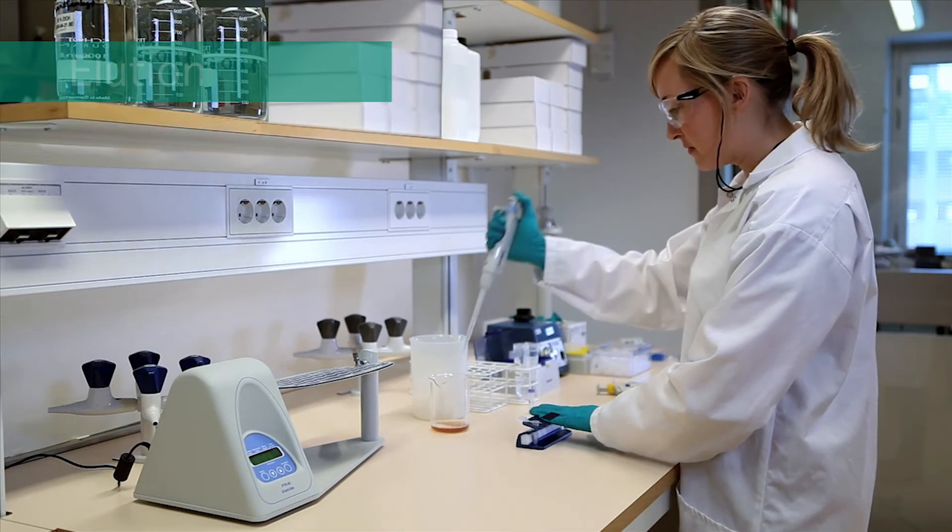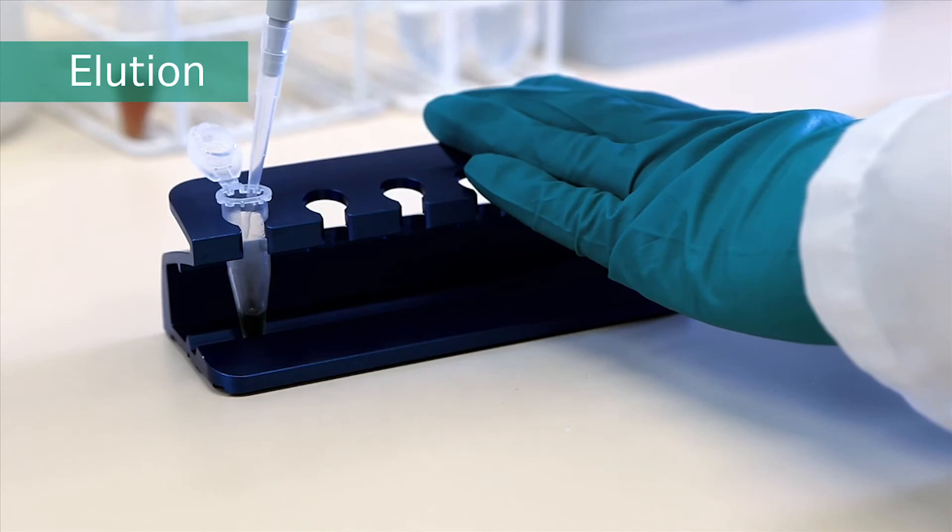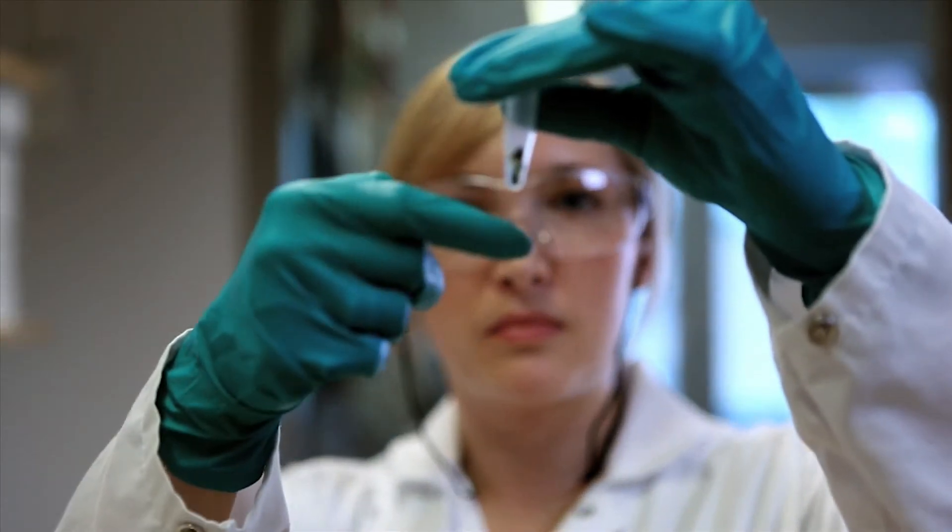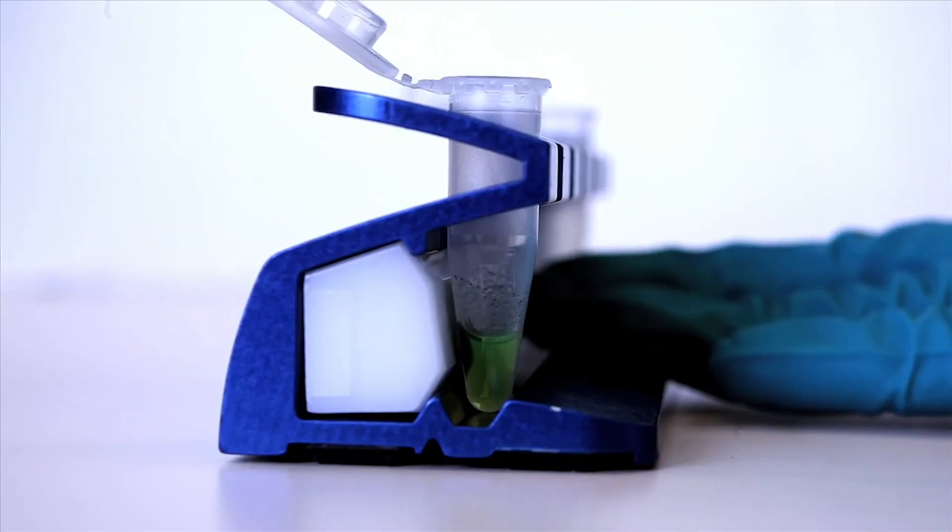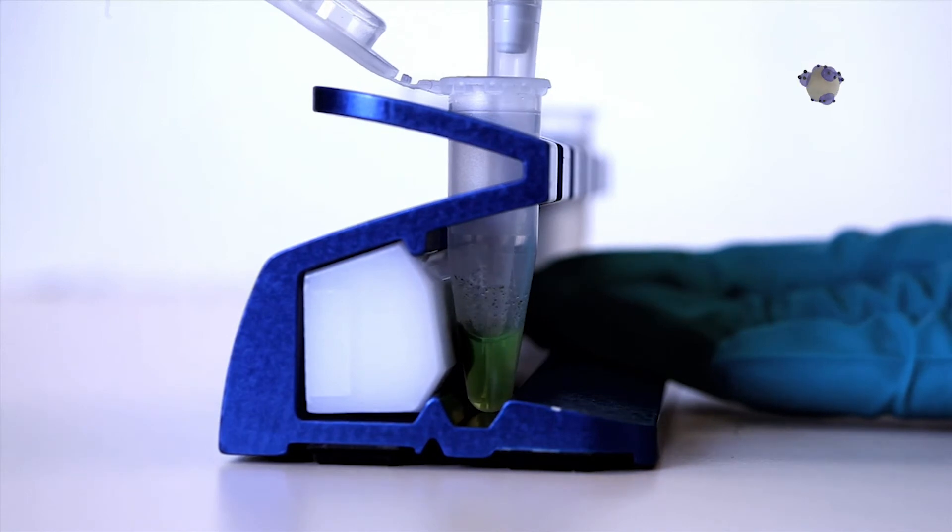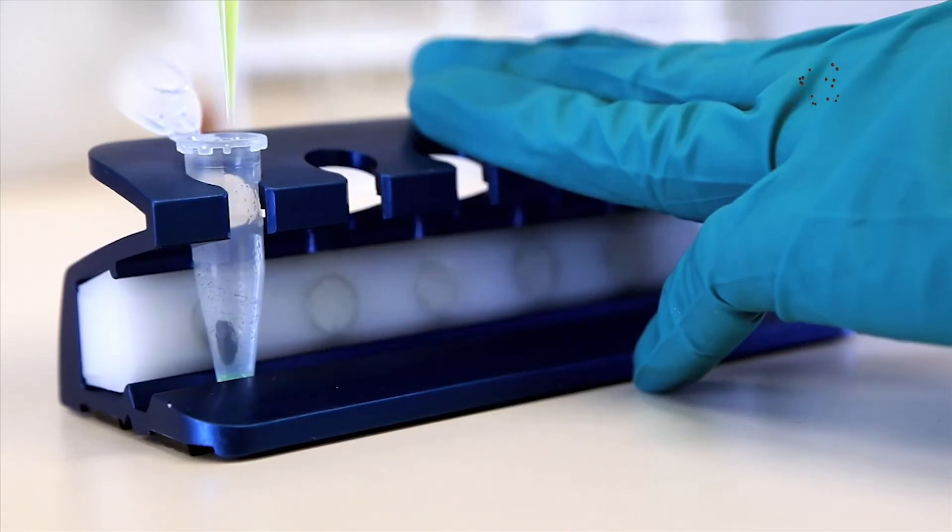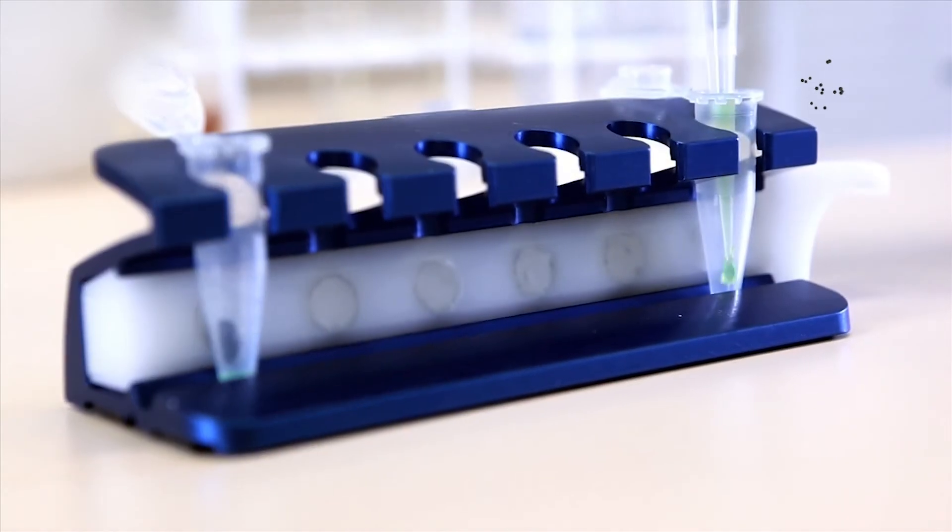Add 100 microliters of elution buffer. Re-suspend the medium. Remove and collect the elution fraction. The collected elution fraction contains the purified protein.